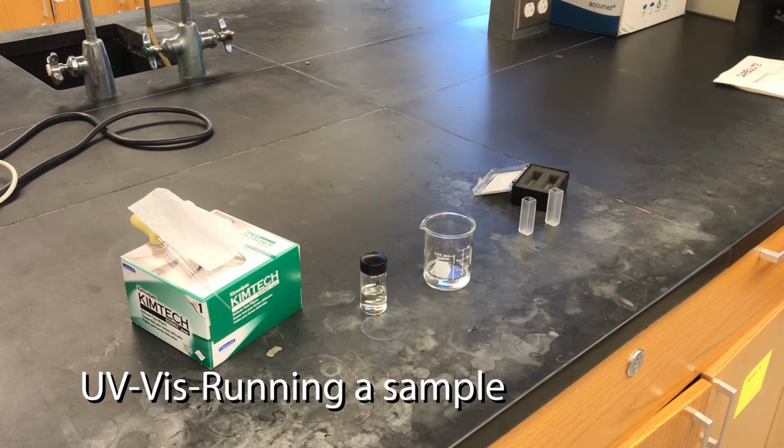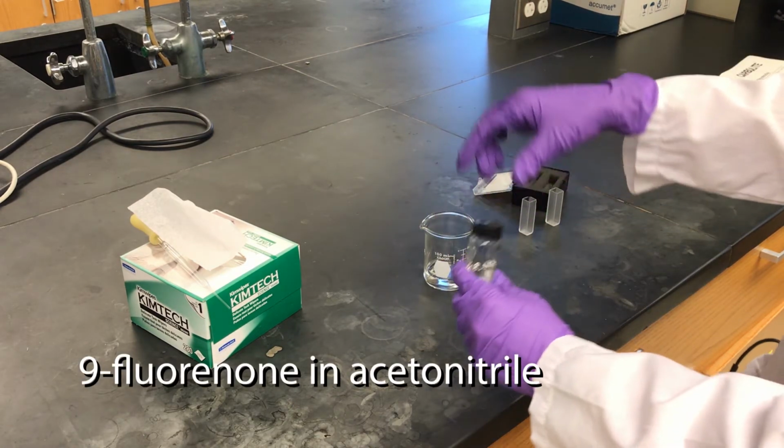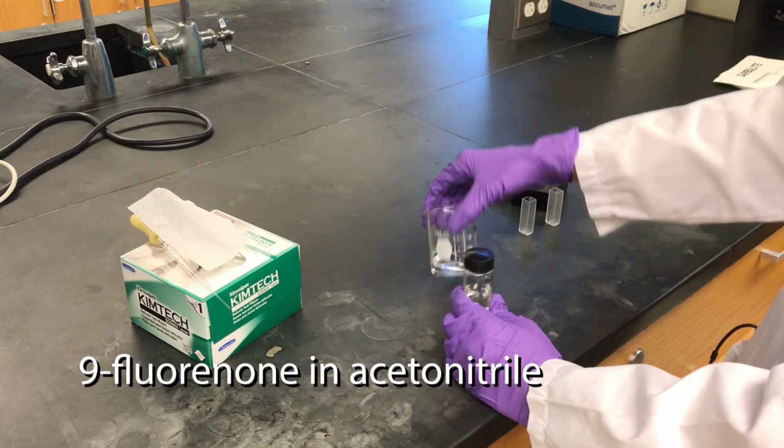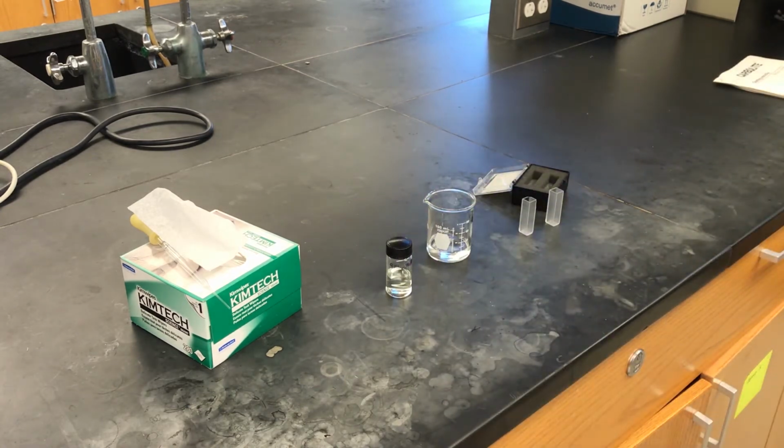Okay, so I've got a sample that I want to analyze on the UV-Vis spectrometer. I take an absorption spectrum of it. My sample is 9-fluorenone in acetonitrile. That's my sample. And I have some acetonitrile here in a beaker.